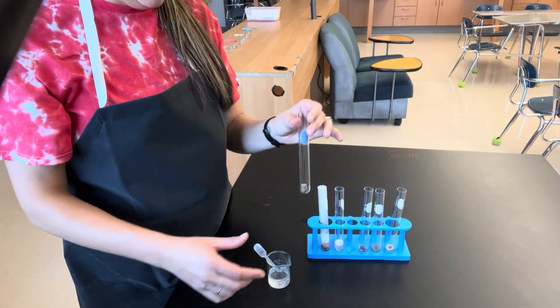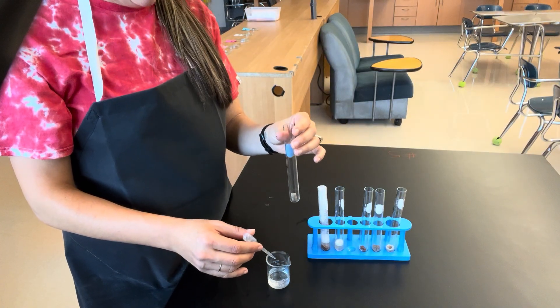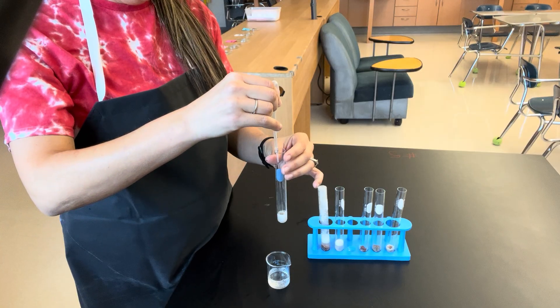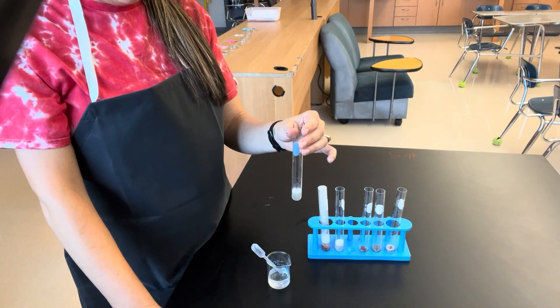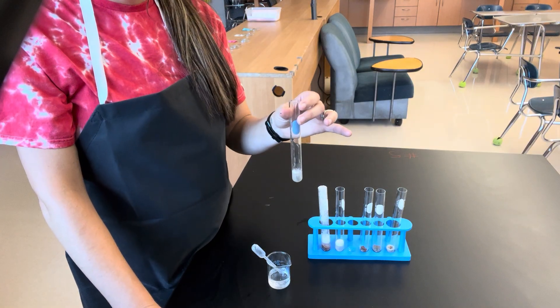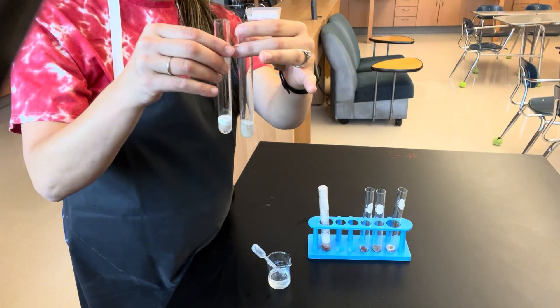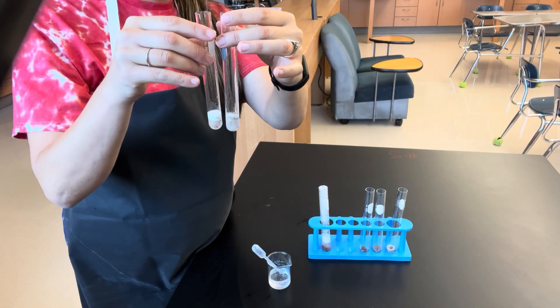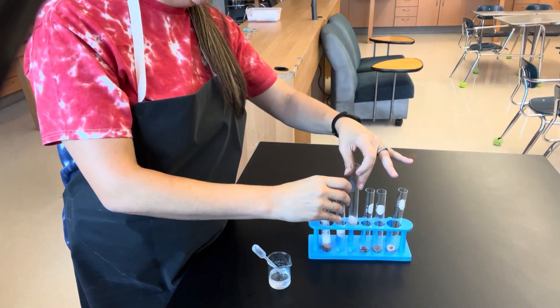Next up, we're going to examine cooked liver. This liver has been exposed to high heat. There are a couple of bubbles, but not really much is going on. When we compare the cooked liver to the potato, you see that the potato does have more of a reaction than the cooked liver.